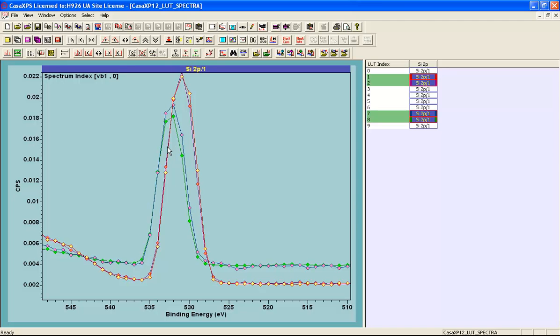So these represent different potentials on the surface as a consequence of a different thickness of an oxide on a silicon. So despite the apparent simplicity of this sample of a silicon oxide on silicon, the fact that we have a variation in film thickness means that the charge compensation and the sample itself have contrived to give us two different potentials on the sample. If we measure a total spectrum, then we would end up with broad peaks. If we choose small area analyses from different positions on the sample, we'll obtain good quality spectra.